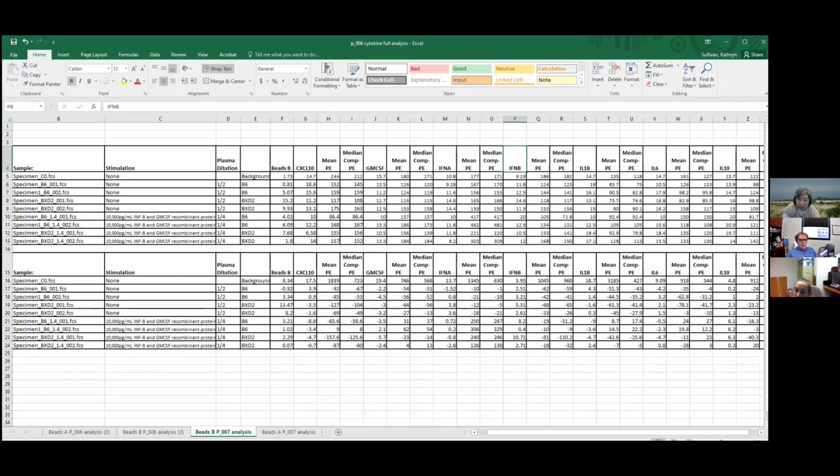So these beads are the same thing. Oh, look, the IL-12 worked, or something that we're not interested in. IL-6 works so well. Yeah, but we're not interested in that. We want to have interferon beta work. Of course, now interferon beta we assume isn't going to work anyway. Interferon beta though, we have the ELISA for that too. Yes, right. So we're already assuming interferon beta won't be detected. But we don't want just the simple things that we're not interested in to work. But we'll see. So that's good.